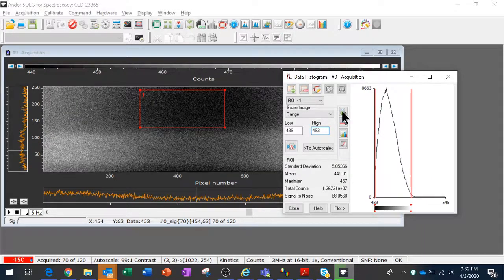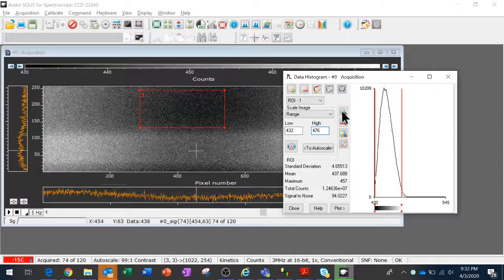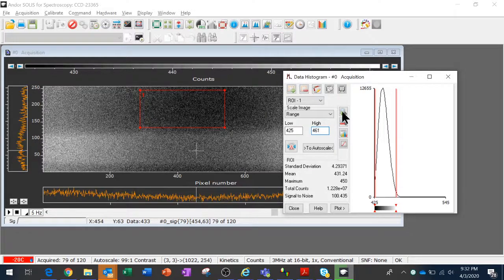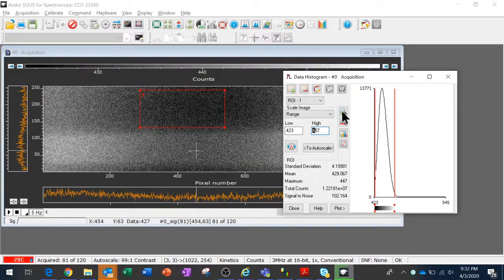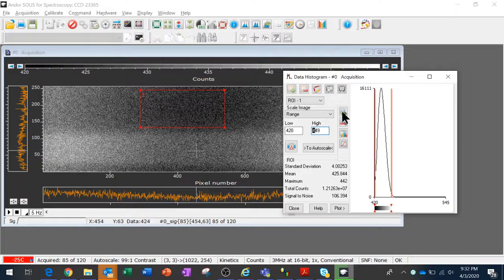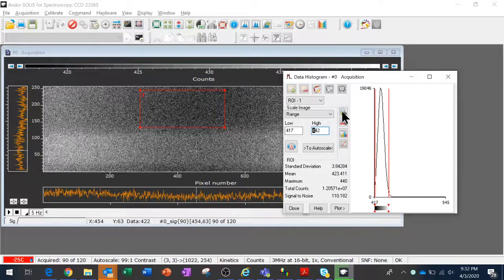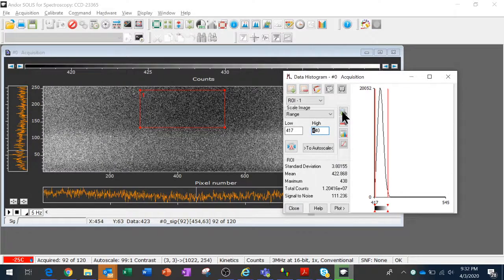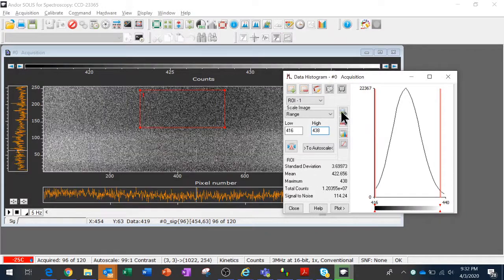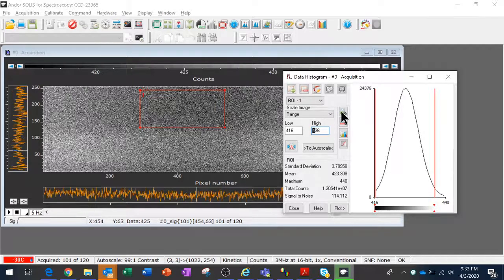And we're collapsing closer and closer to the offset. I'll show you how to remove that offset with a bias frame in a separate video, so stay tuned for a video on bias frames. But for now, I just want to show the general trend. So we're only at -20. We've got a long way to go, and we've already eliminated the lion's share of our dark current. But I'm going to let this run for a few more degrees just to make sure that my point is made. Zoom in again. And it's going to continue shrinking asymptotically towards the offset as time goes on.